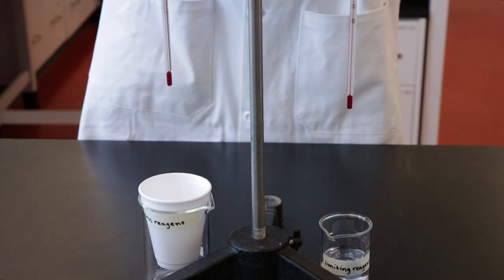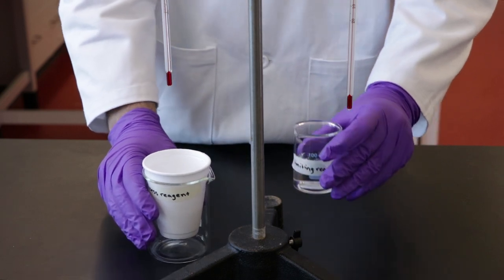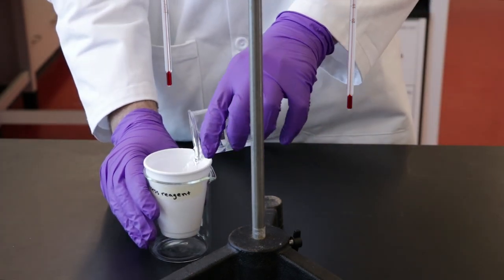At the five minute mark, pour the contents from the beaker into the styrofoam cup and swirl the solution. Do not record the temperature at this time.